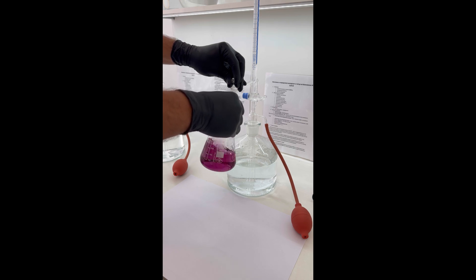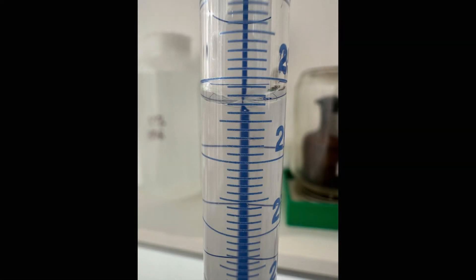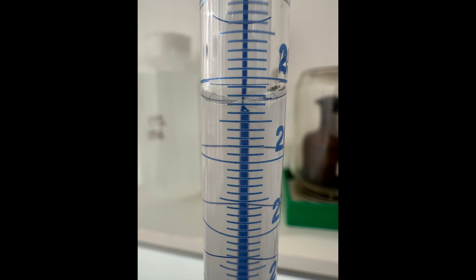It is then titrated with the newly prepared EDTA solution until the color changes to blue, indicating the endpoint. In my case, this took 25.25 milliliters.